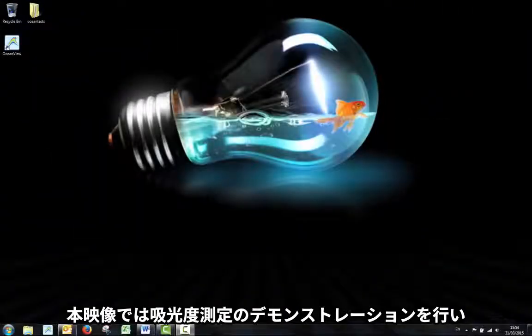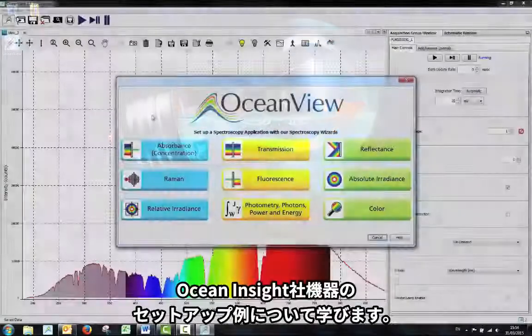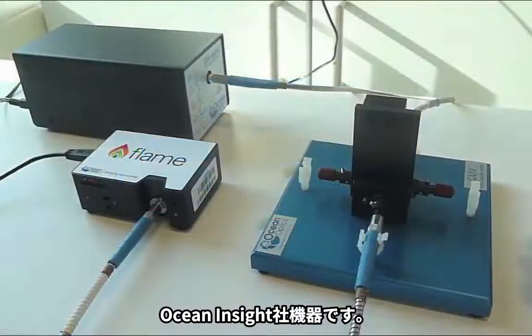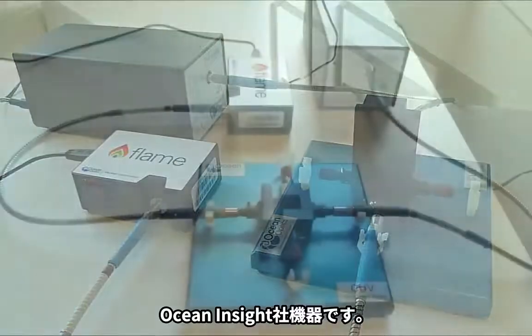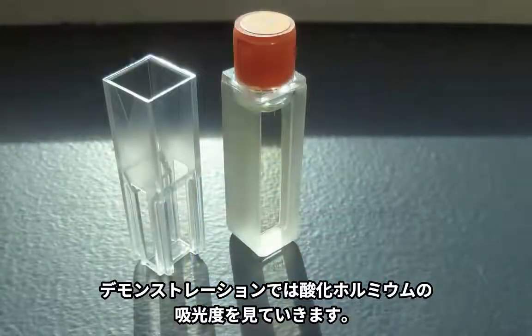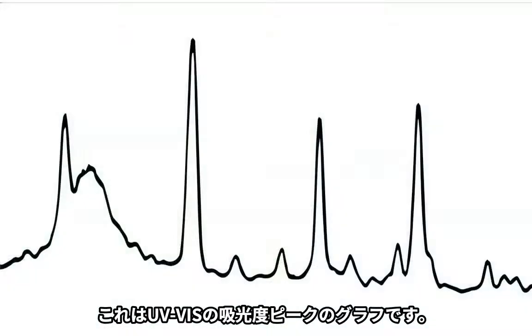This video is going to demonstrate how to set up and take absorbance measurements, showing you the simple way to use OceanView software and an example setup of Ocean Optics equipment. For this demonstration, we will look at the absorbance of a holmium oxide Starna Scientific absorbance standard. This absorbs in the UV and visible ranges in sharp, recognizable peaks.